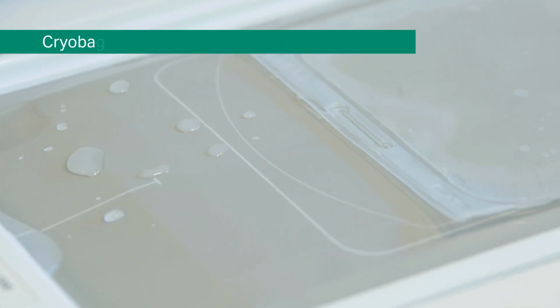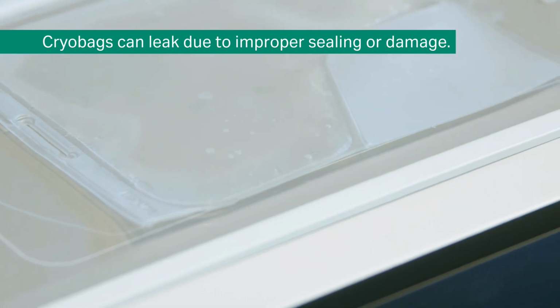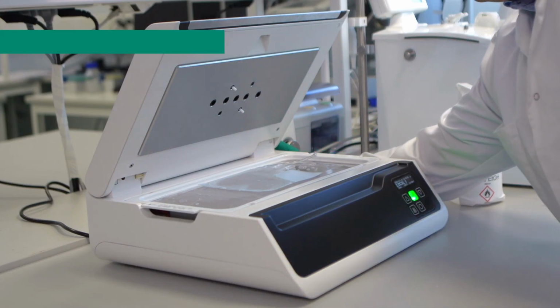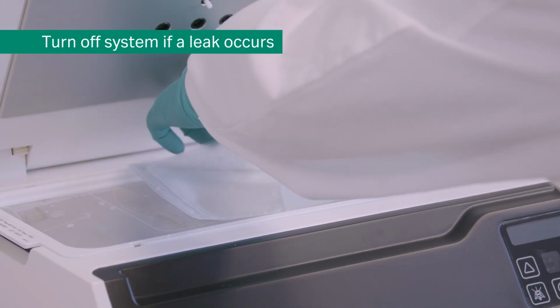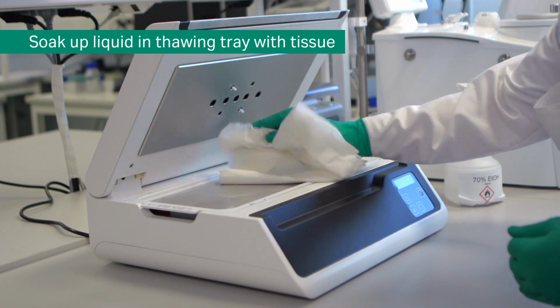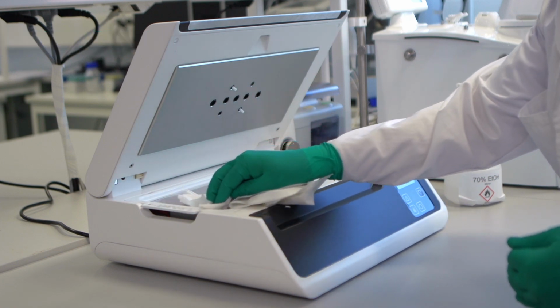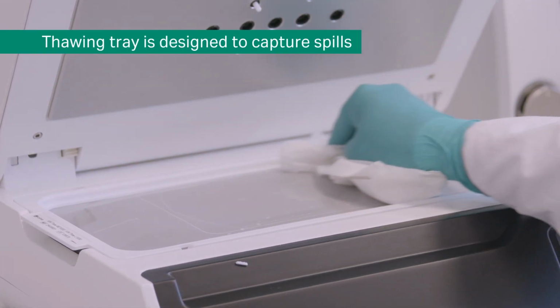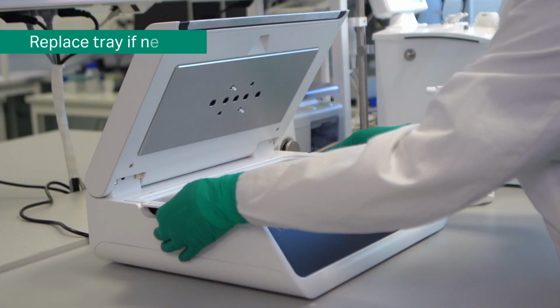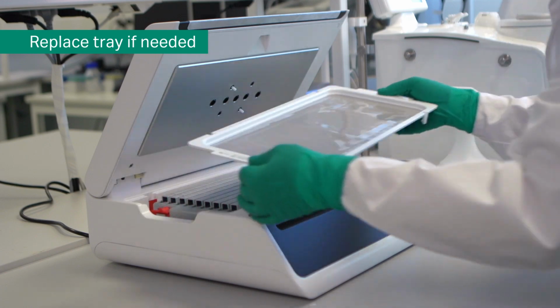Cryobags may leak during the thawing process due to improper sealing or damage during manipulation. If a leak happens, press the power switch to the off position and wipe the thawing tray to soak up all fluid. Always wear the appropriate protective equipment. The thawing tray is designed to capture all spillage and avoid contaminating the rest of the instrument. The tray can also be replaced if needed.